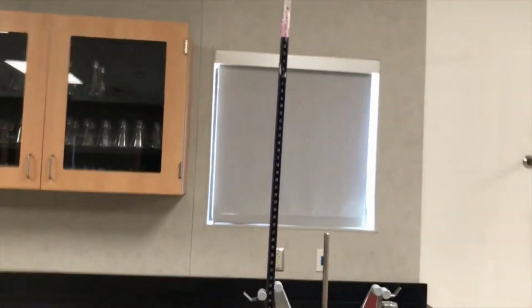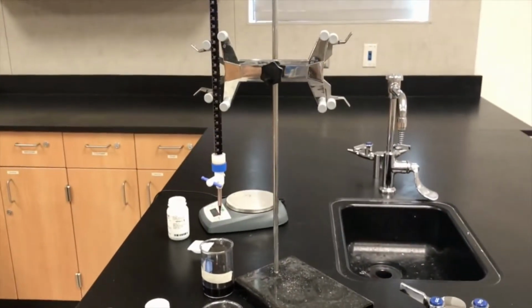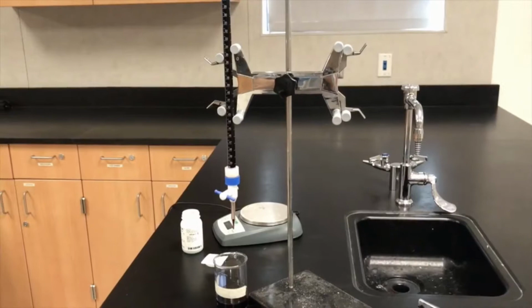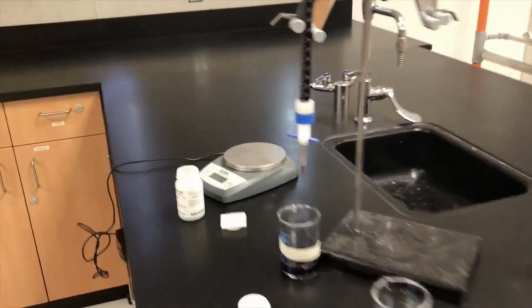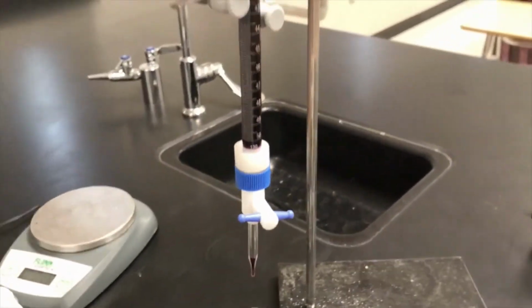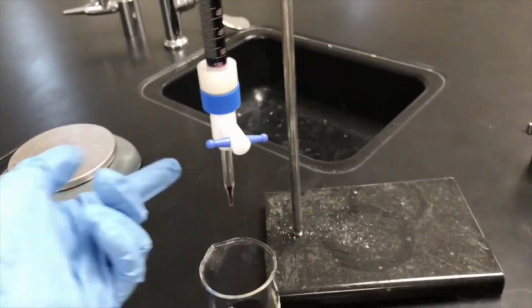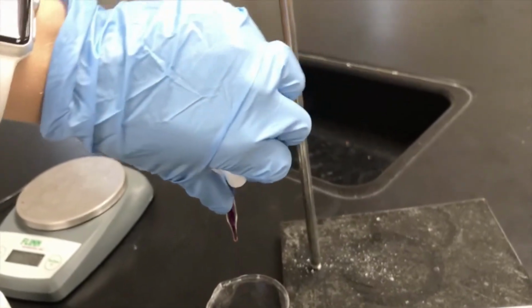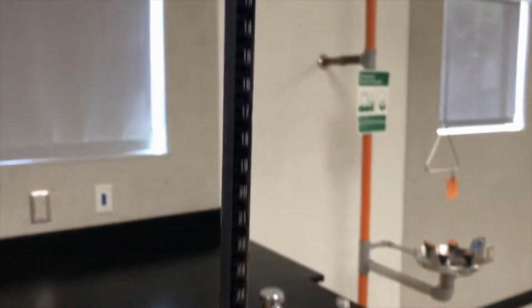The one thing I need to do, and look in the directions what it tells you to do, it says open the stopcock to allow any air bubbles to escape, close the stopcock when the liquid level is between 0 and 10 ml. If you notice right now, at the very base of my burette, there's air, right? If I were measuring this volume right here, I'm assuming it's potassium permanganate, which it's not, it's air. So I've got to get rid of that air, allow it to drain a little bit. Now that the air is gone, I can actually measure the volume.